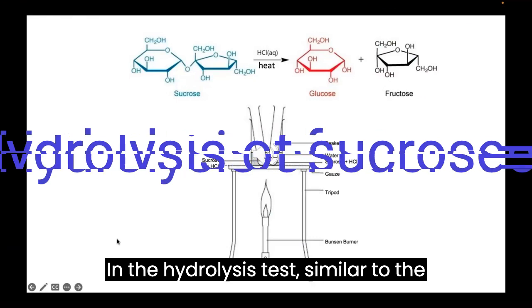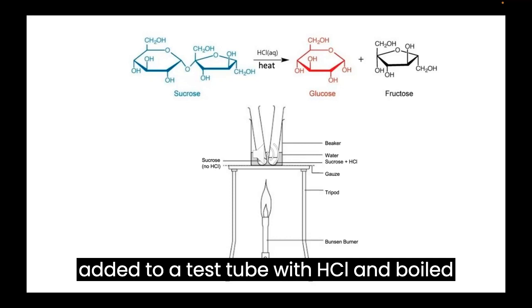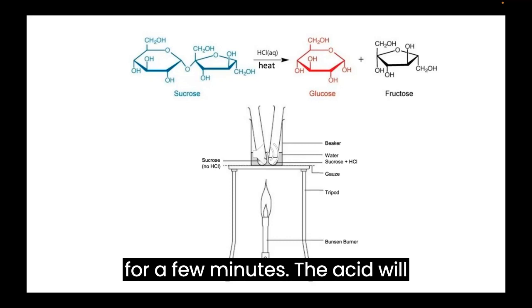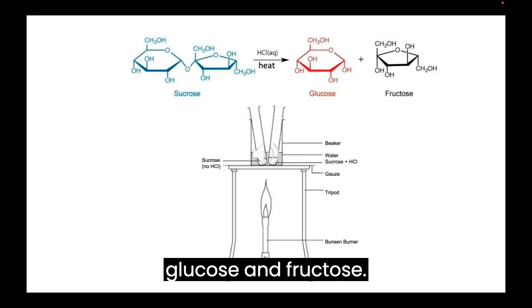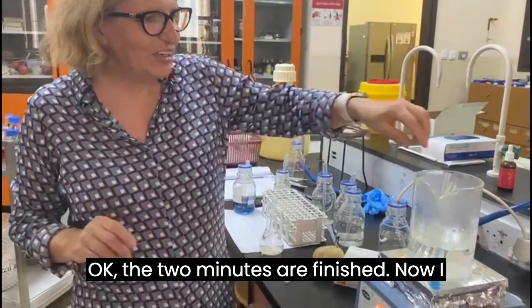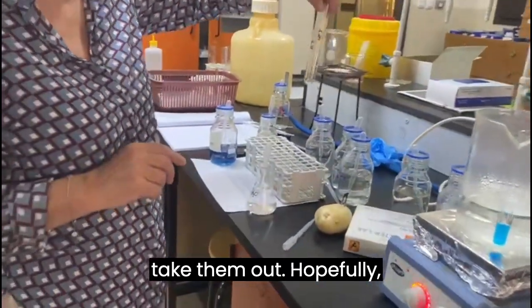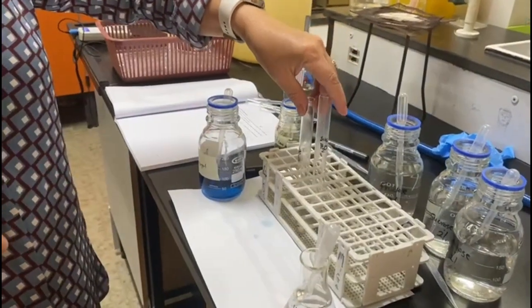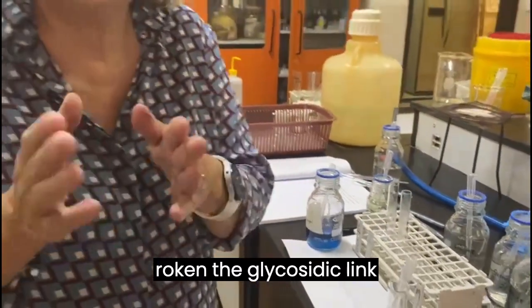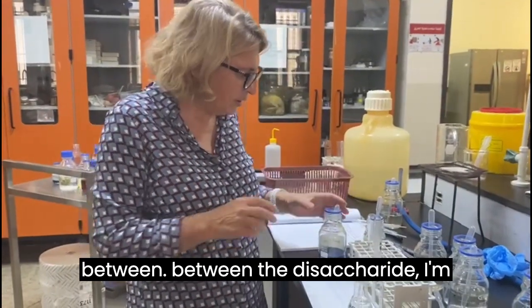In the hydrolysis test, similar to the way you make sugar syrup, sucrose is added to a test tube with HCl and boiled for a few minutes. The acid will hydrolyze the glycosidic bond between glucose and fructose. Okay, the 2 minutes are finished. Now I take them out. Hopefully the HCl has broken the glycosidic link between the disaccharide.